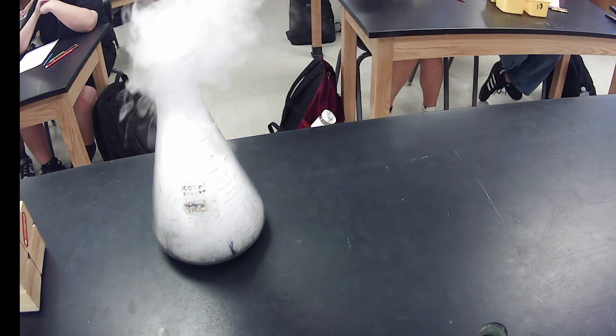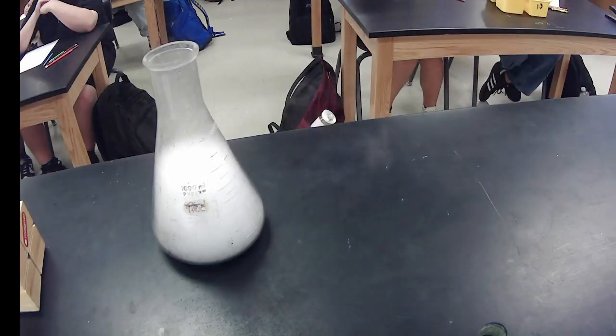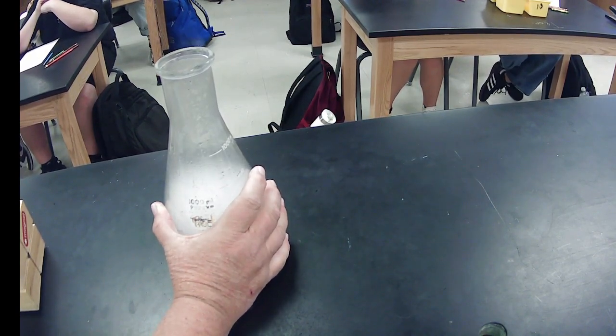So now you can see, what did that do for the reaction of the decomposition? Did it speed it up or slow it down? Speed it up. Okay? Now what we can see is this is just all water vapor and oxygen. I'm not too worried about it. But if you look, number 1, it's very hot. So if it feels hot, is it endothermic or exothermic? Exothermic. And also you can see at the bottom, can you guys see down there?